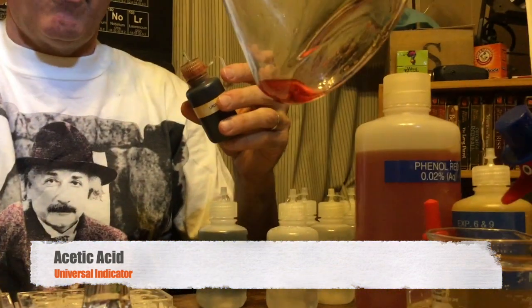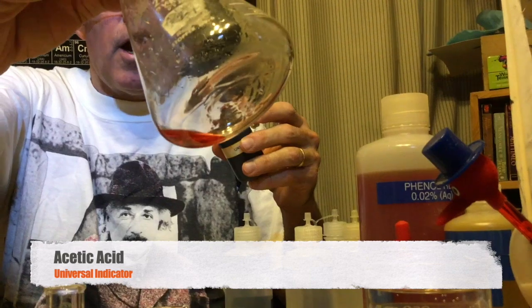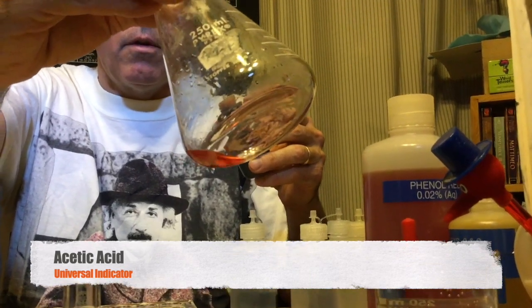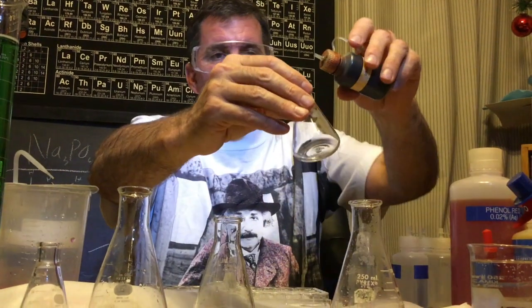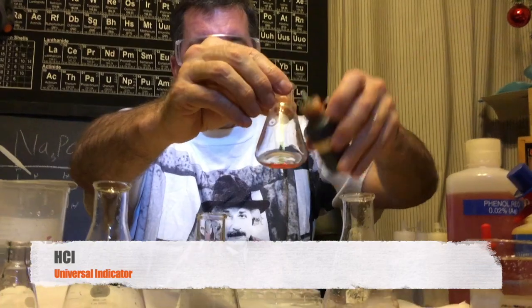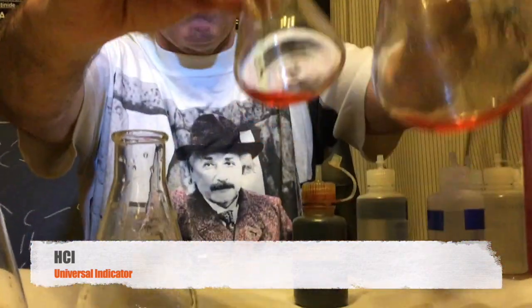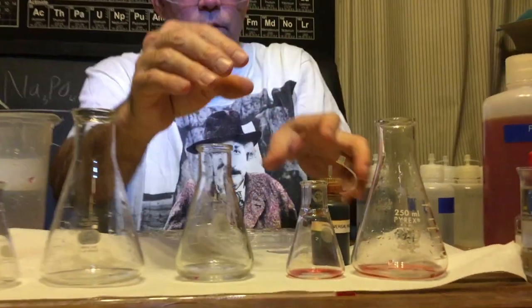So that's universal indicator in acid. Make sure you make good observations and write them down. That was acetic acid. Here is hydrochloric acid. Okay, sodium chloride.